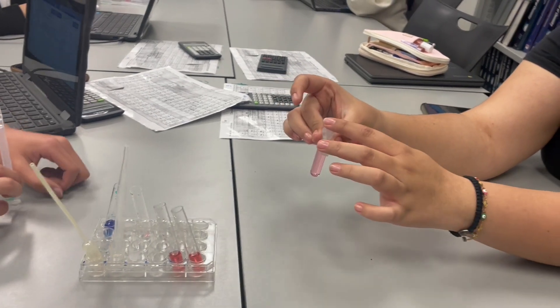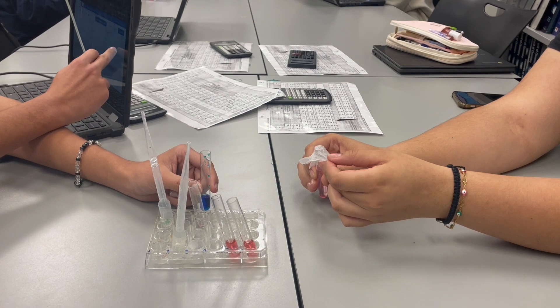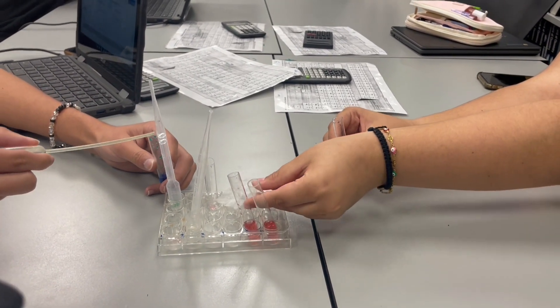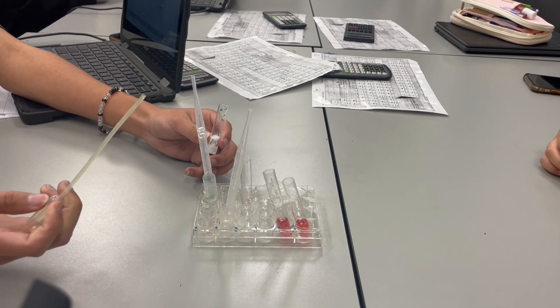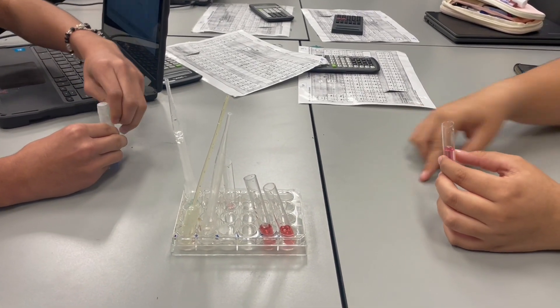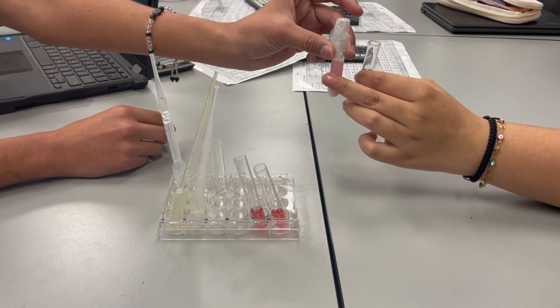Record it into the other one. You're now adding silver nitrate. What are you doing? It takes the chloride off — very good. So now you're adding the silver nitrate, which is basically removing the chloride ion. So the chloride — which is a reactant — is being removed. Shake, shake, shake.